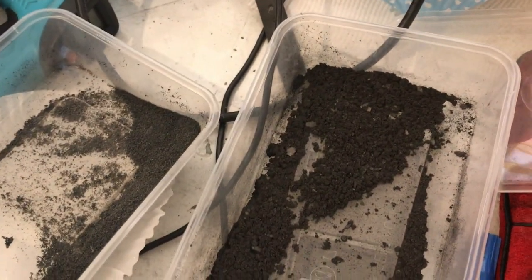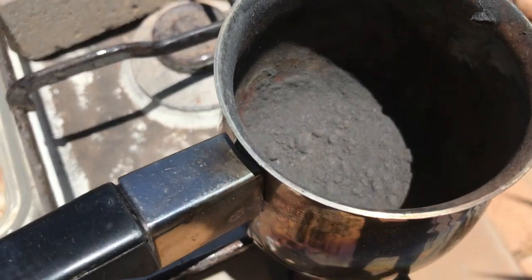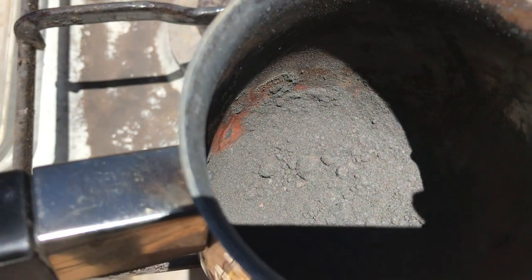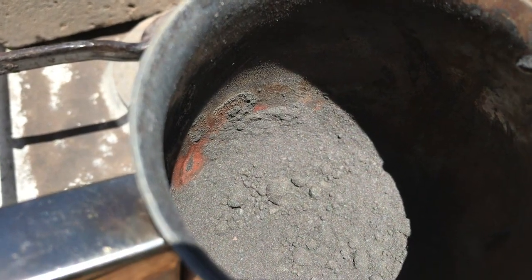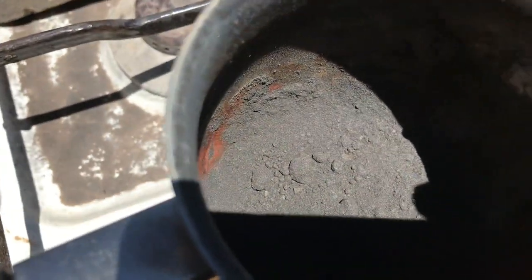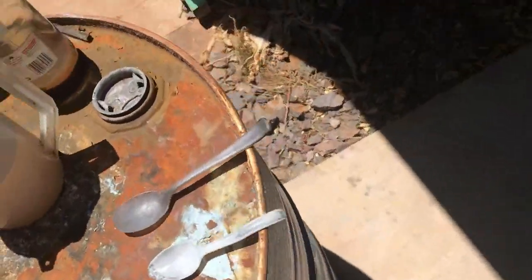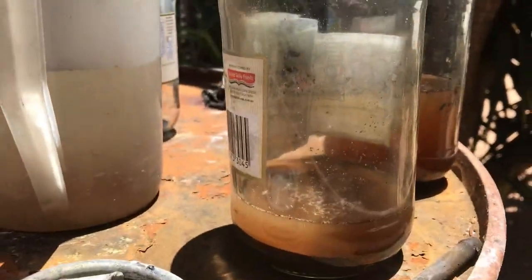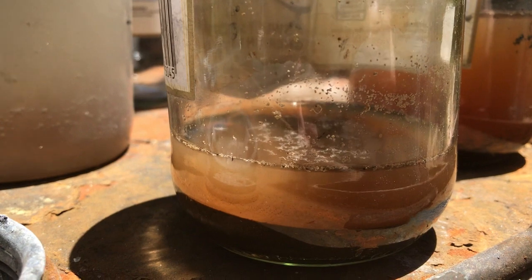This is the second attempt — it's slightly expanded but I think the particle size is still too small. This time I changed the concentration: I used 20 ml of sulfuric acid and one gram of potassium permanganate for the 96% graphite content. I've also got the larger graphite which actually looks like graphene oxide because it's brown rather than black — graphene oxide is supposed to be sort of brownish.